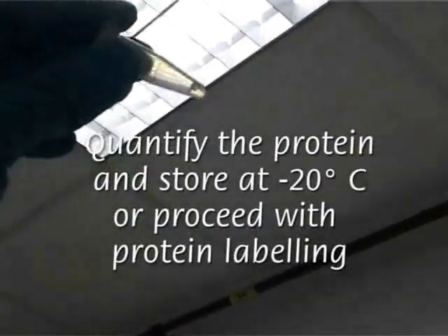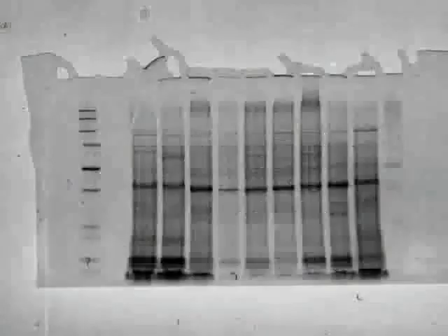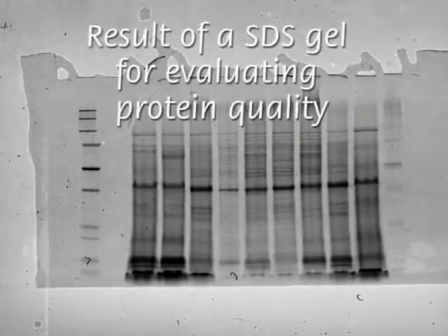Before proceeding to the expensive 2D DIGE labeling, protein quality is tested on an SDS-PAGE 1-dimension gel. As can be seen, the absence of significant smears on the edge of a lane suggests a good quality of the sample.